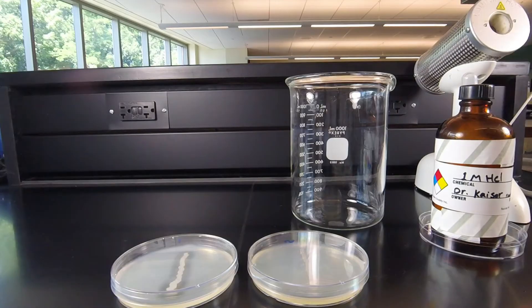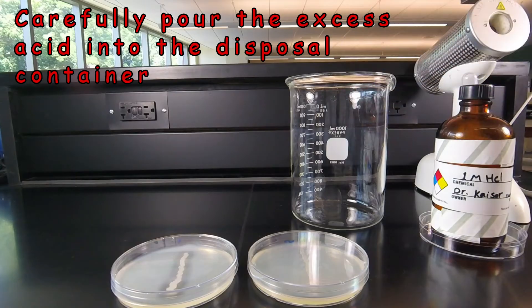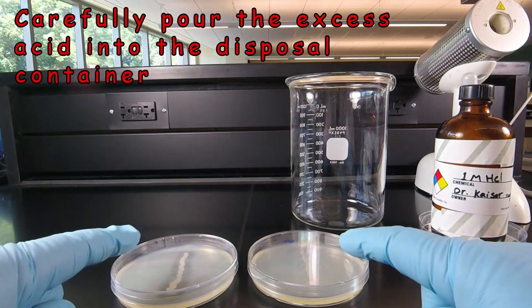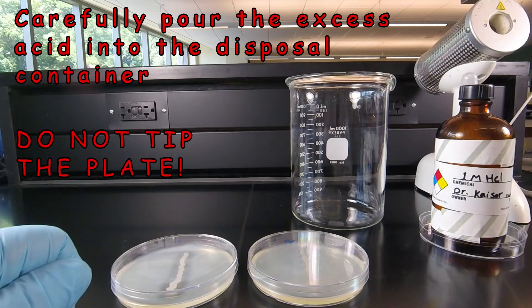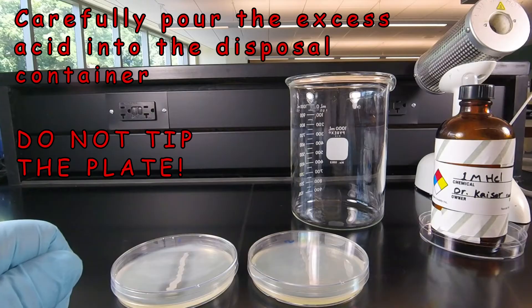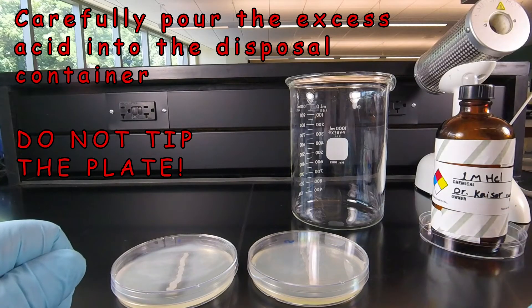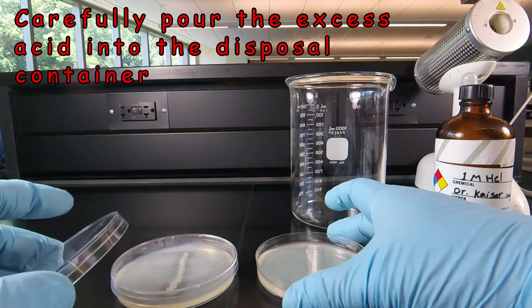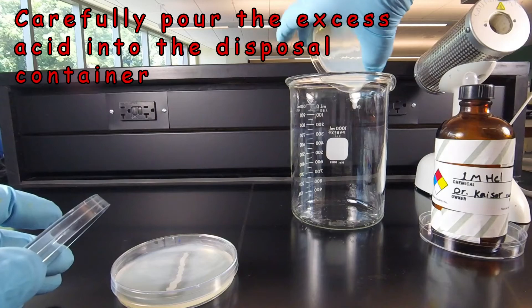Now that a minute has gone by, we're going to pour the excess acid into our disposal container. We need to be very careful with this — we don't want to pick the plate up and look at it, because that acid will run out of the Petri plate and run all over you or onto the bench top. We have to make sure all the excess acid has been removed from the agar surface.